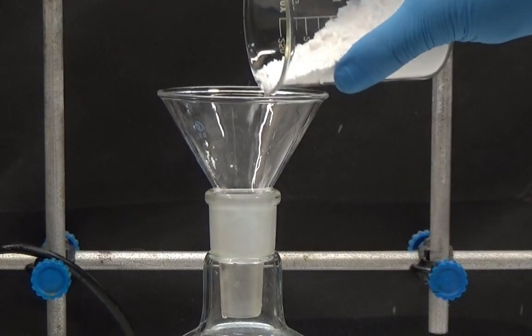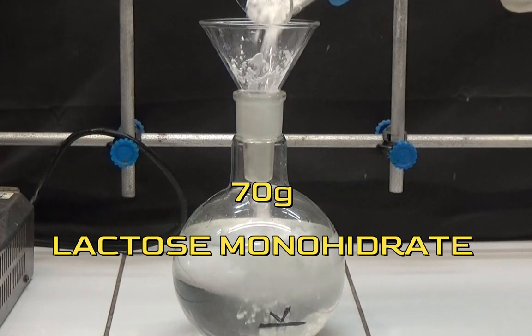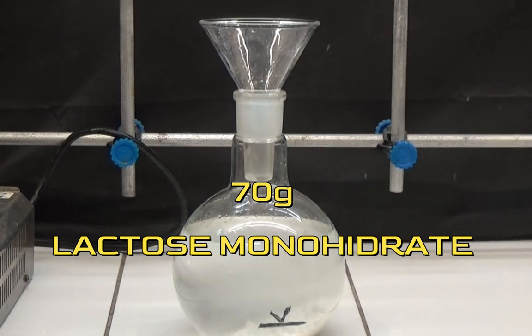To this solution, we add 70g of lactose monohydrate and shake it to homogenize the solution.